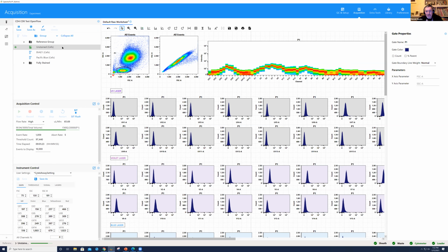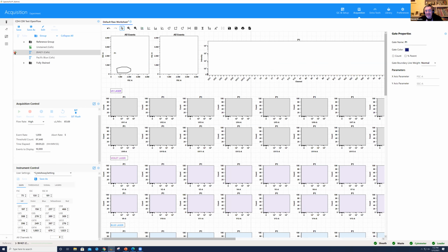Yeah, so Jim has put in the Q&A that 400 was recommended. I think he's just been on the training course. So for the positive, probably. For the positive, yes, exactly. I think for me personally, the CV of the data goes down a little bit when you have 1,000. I've always looked at that when you have a rare population of interest. I try and get to at least 1,000. That's my preferred number, but 400 does work.